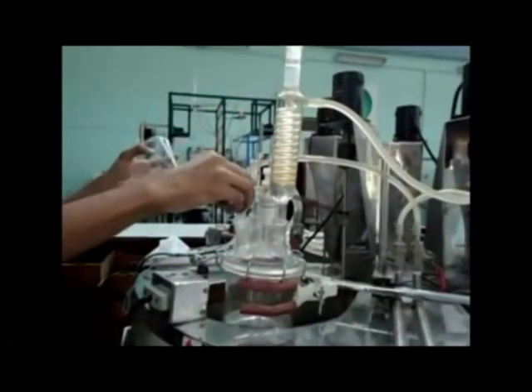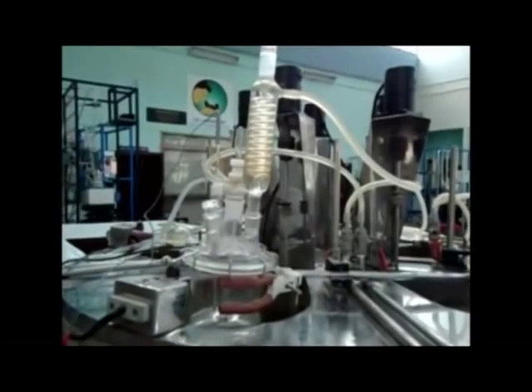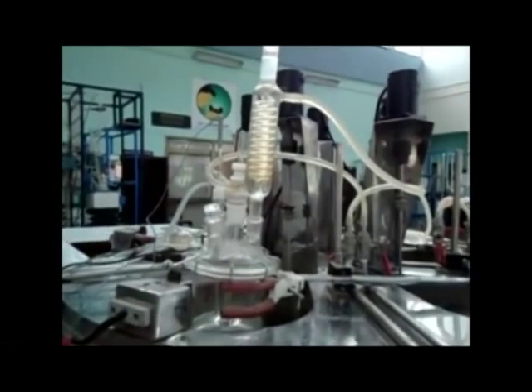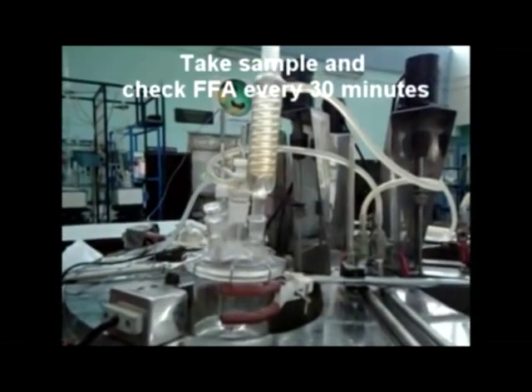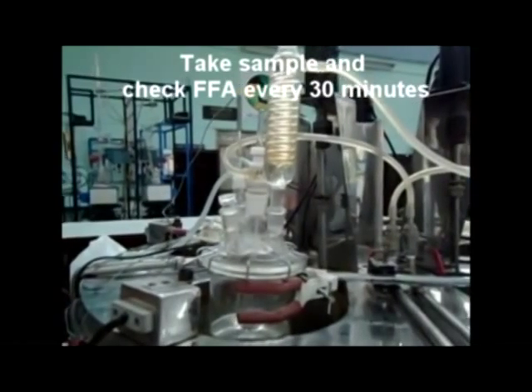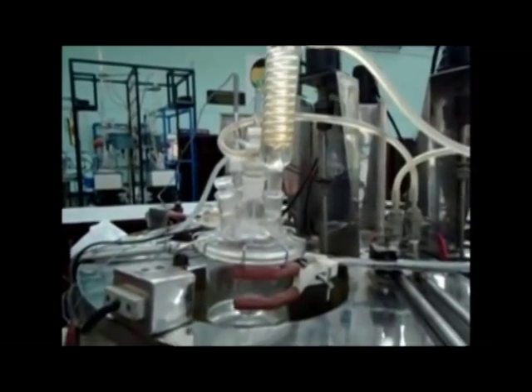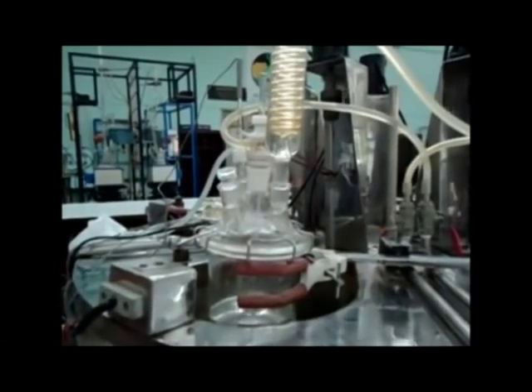Make sure to close the reactor's mouth using a cap. Let the reaction take place, and after every 30 minutes take a sample and calculate the percentage FFA content. Once the FFA content reaches less than 1%, stop the reaction.